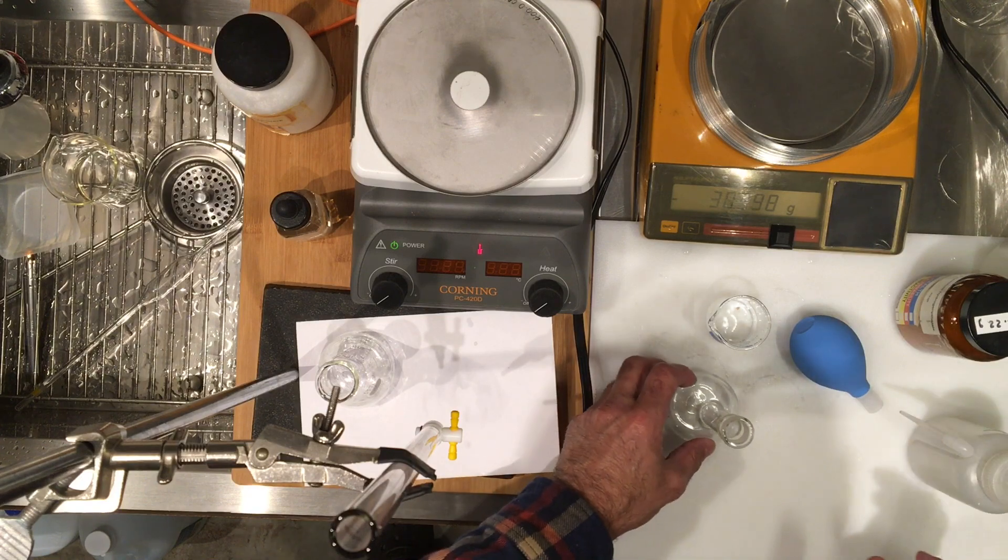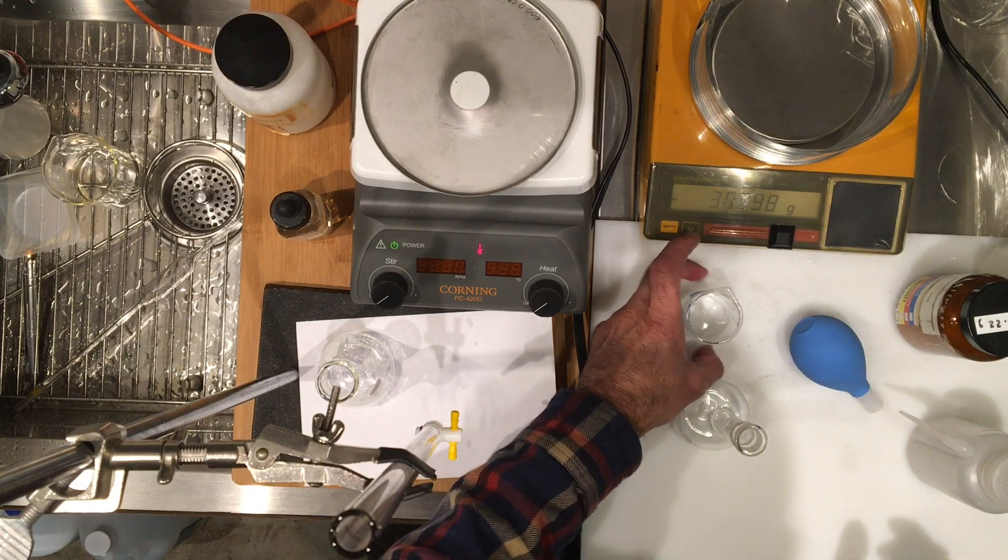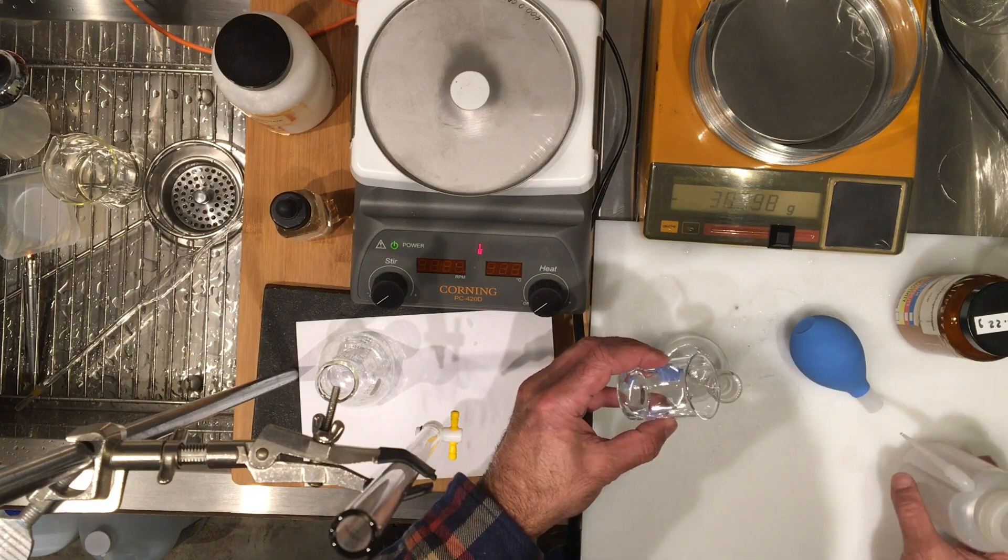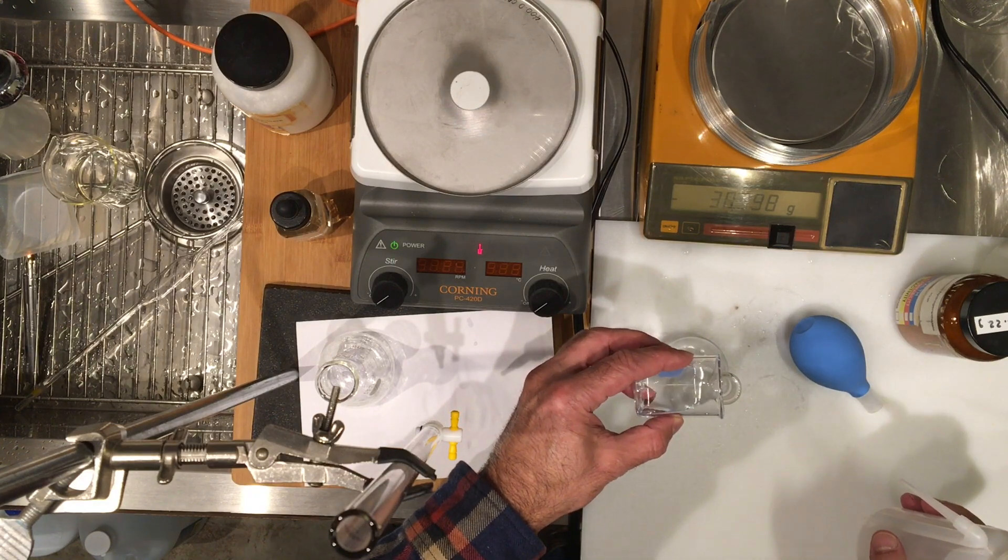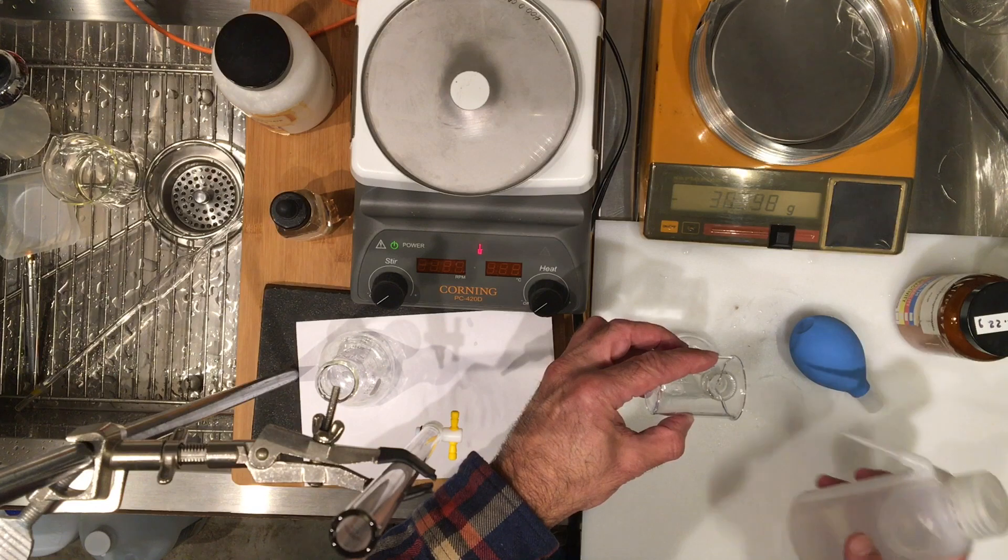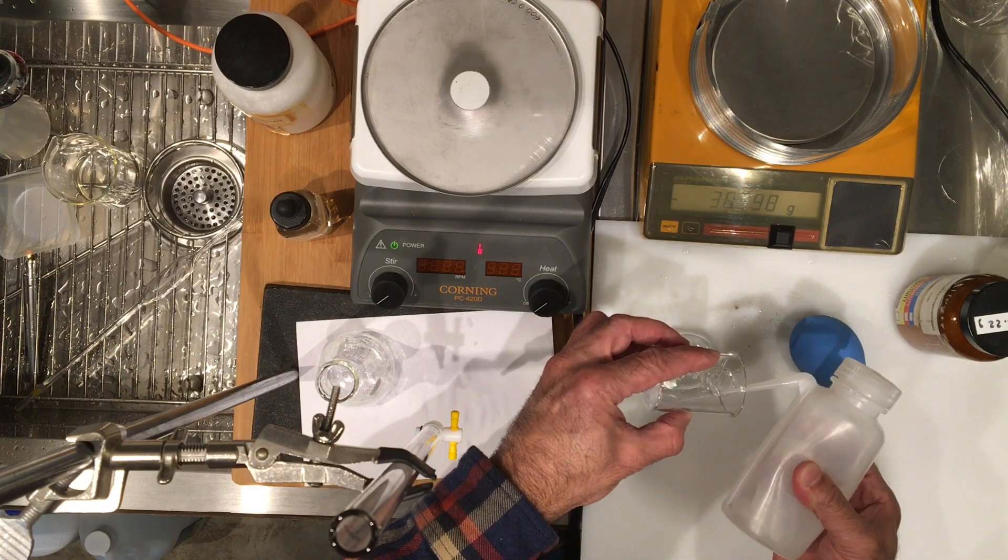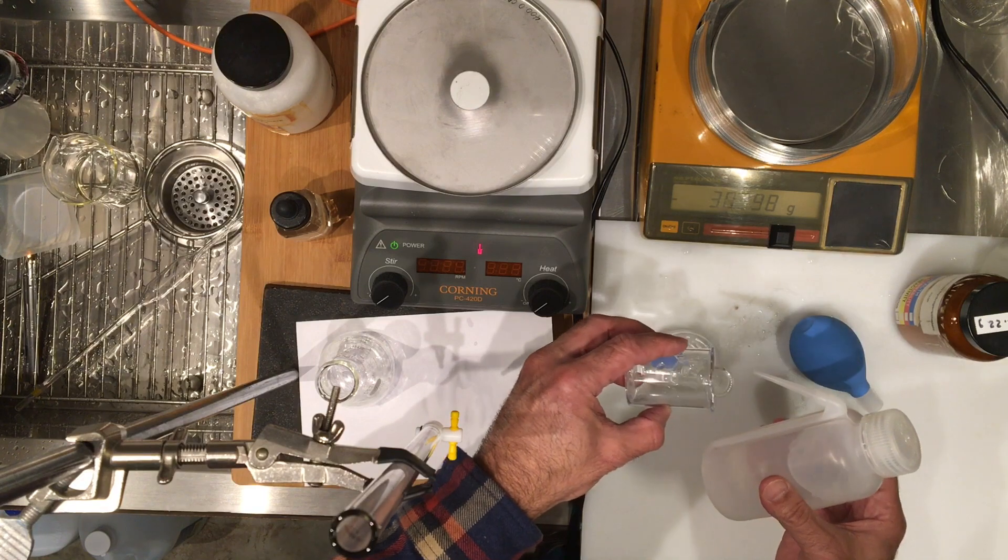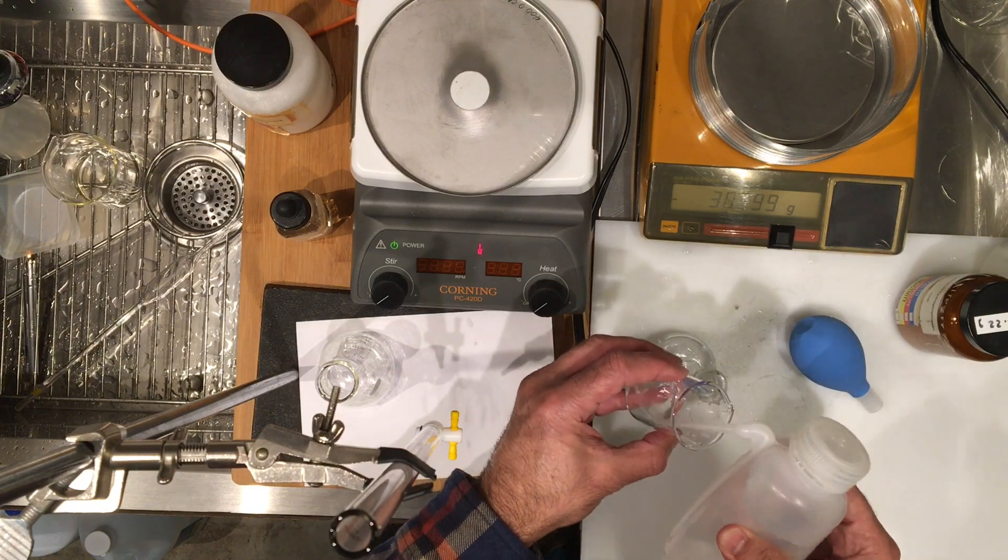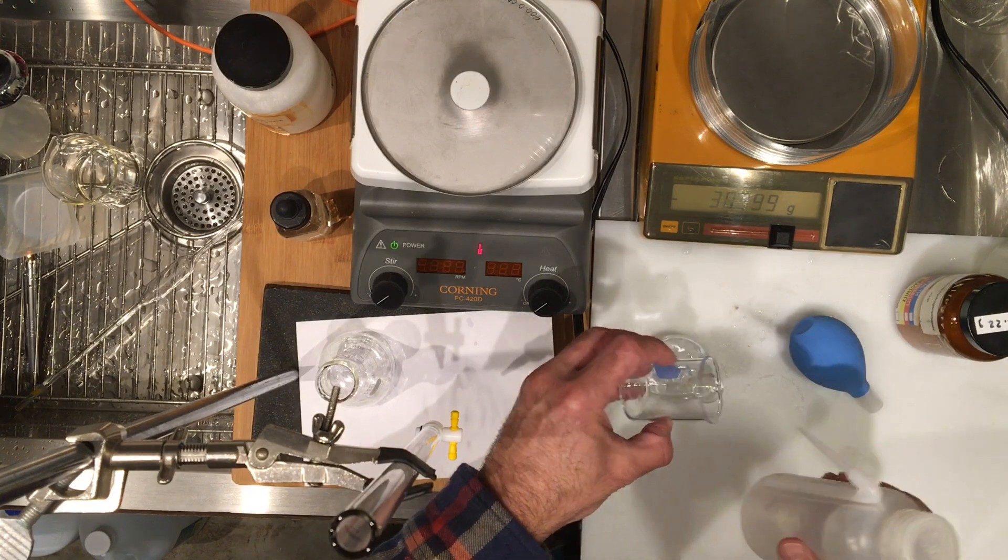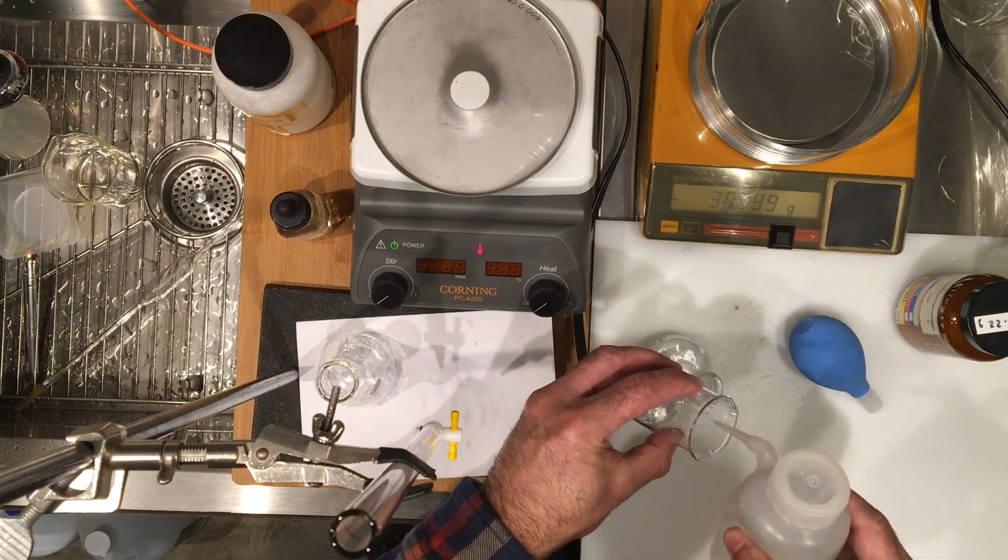Because as I told you, we need to dilute the vinegar down before our titration, to have a reasonable volume of the sodium hydroxide. So I'm going to transfer this to my flask, it's a quantitative process, so I want to make sure I get all of the vinegar out. Usually three rinses will be good enough.